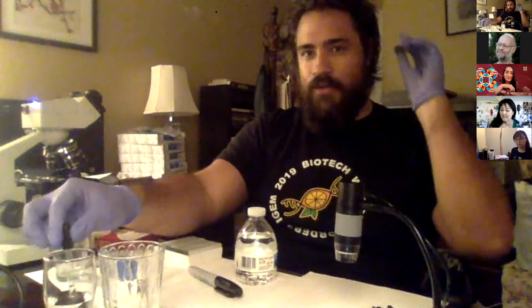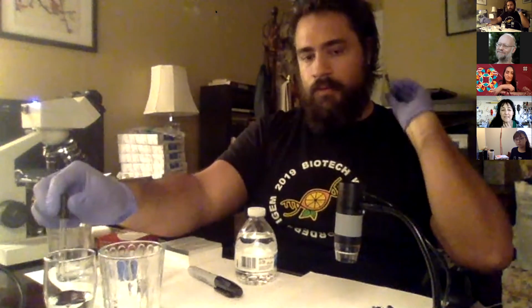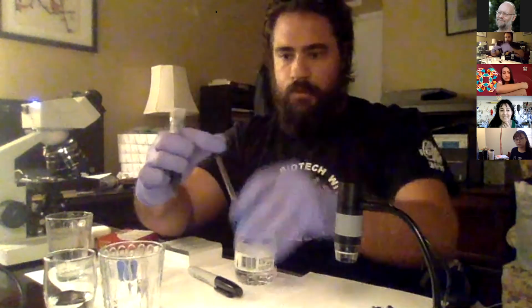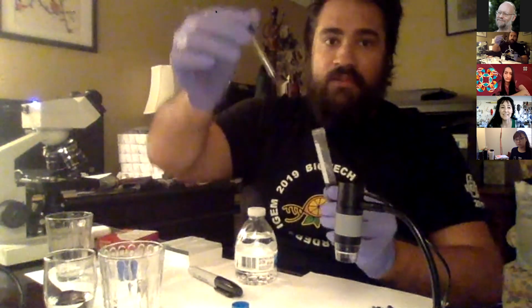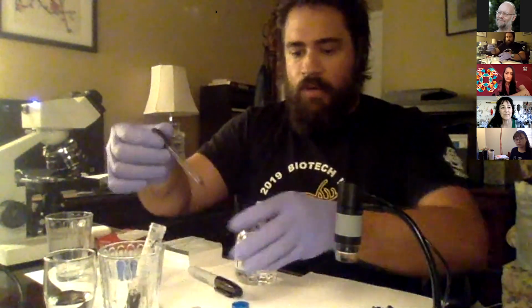I'm going to switch hands because I'm right-handed. So I'm going to get my little eyedropper. I'm going to squeeze out the water. Okay, cool. Now I'm going to open her up. Going to go in there, going to get a little drop. Cool. And I've got a nice little suspension of microbes in there, and I want just 1 drop.